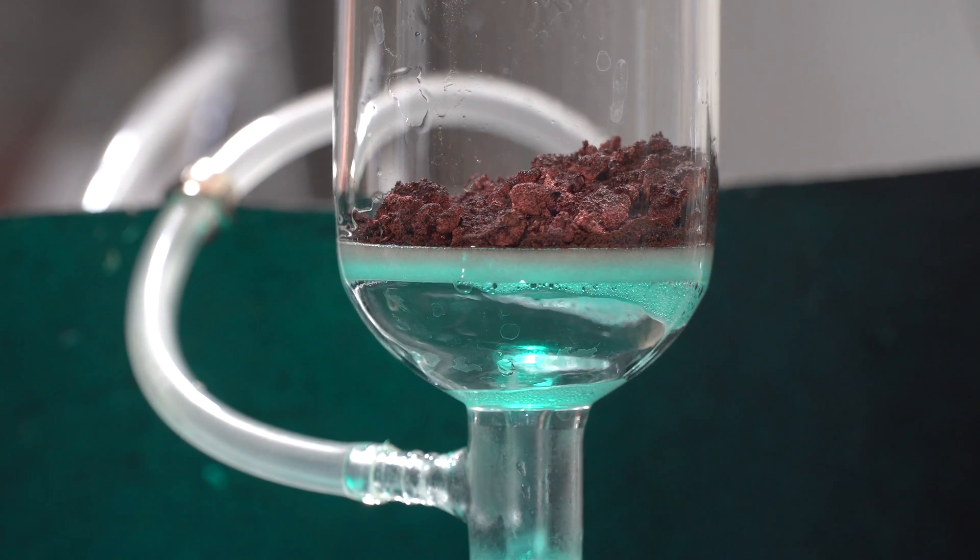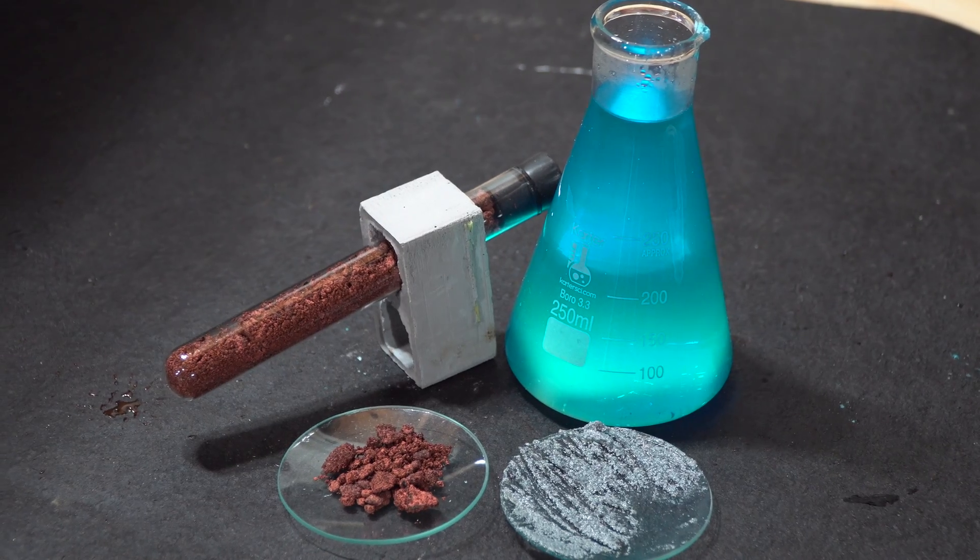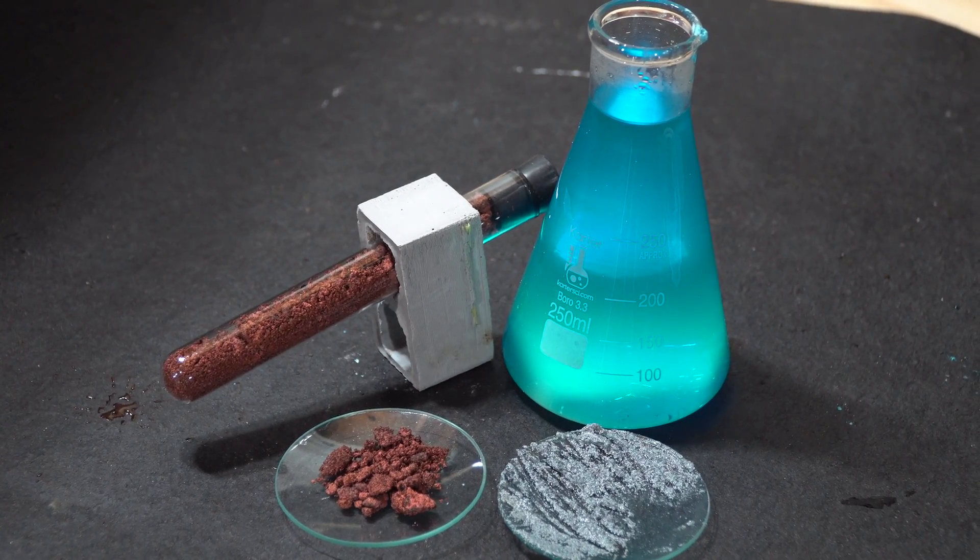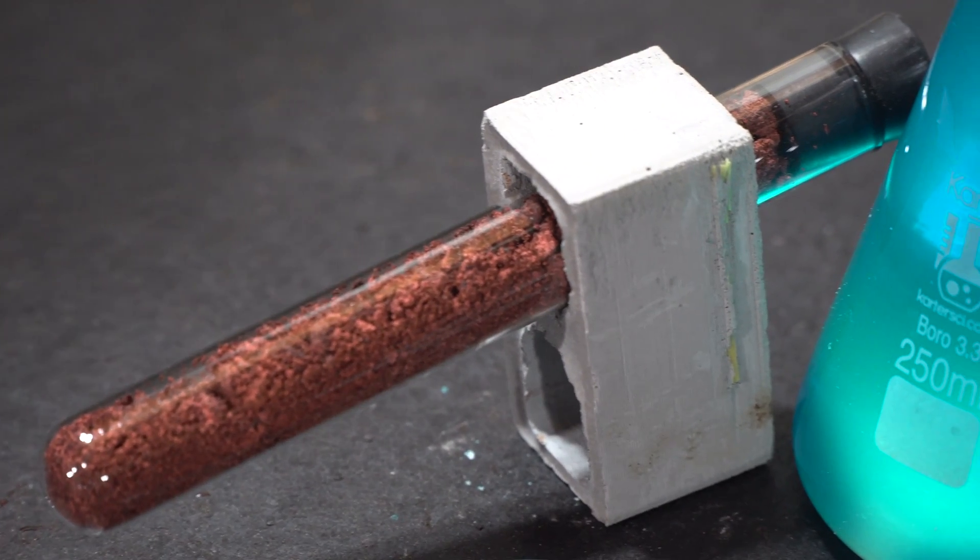And there you have it, copper metal. In the beginning we had zinc and copper sulfate, and now we have copper and zinc sulfate. Pretty cool.